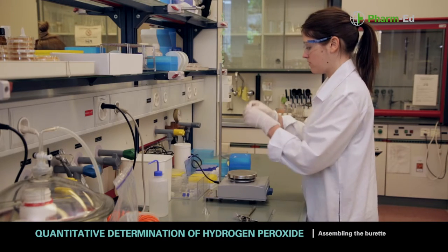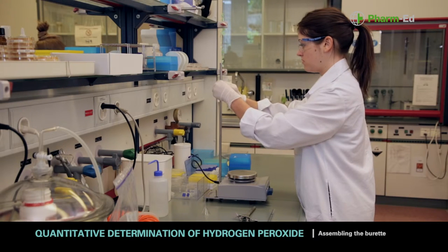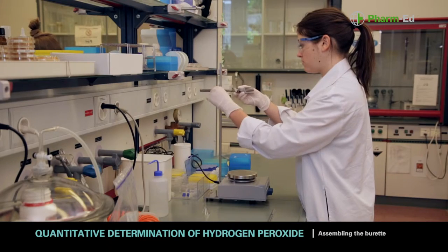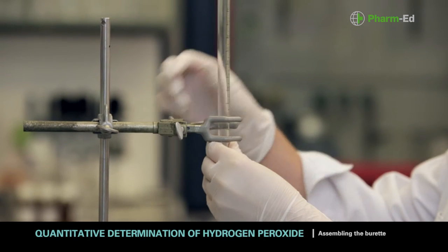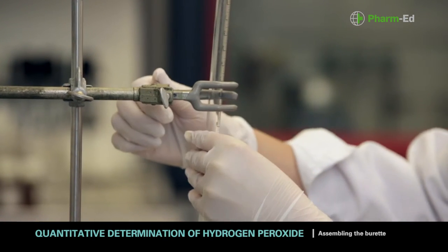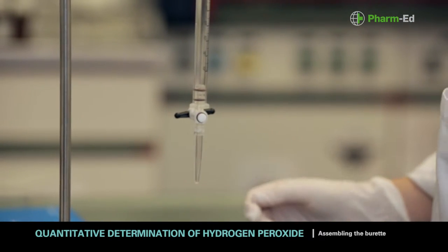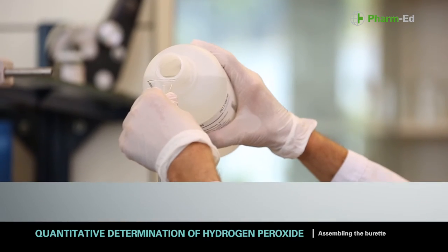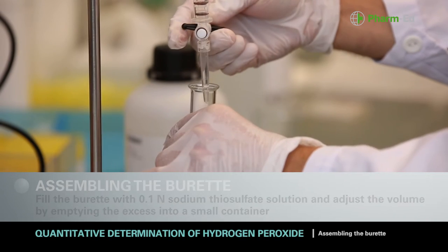Before preparing the solutions for analysis, assemble the burette. Fill the burette with 0.1N sodium thiosulfate solution and adjust the volume by emptying the excess into a small container.